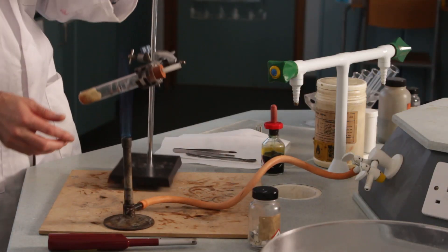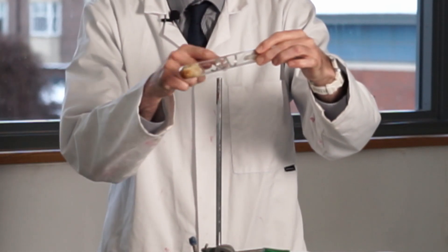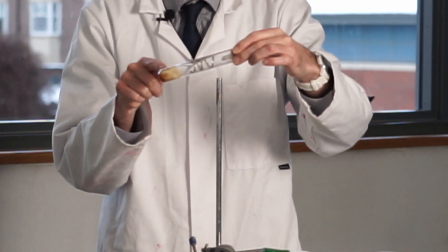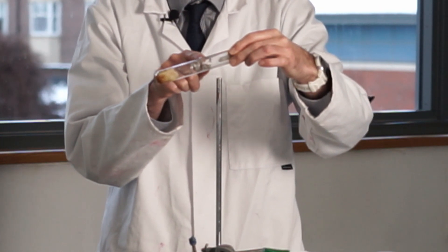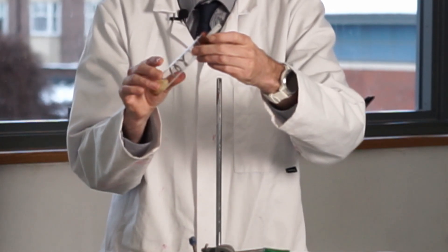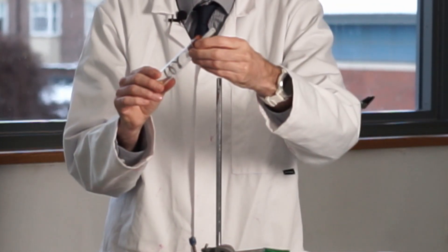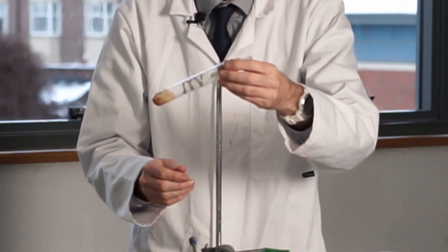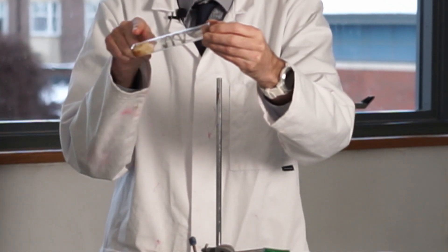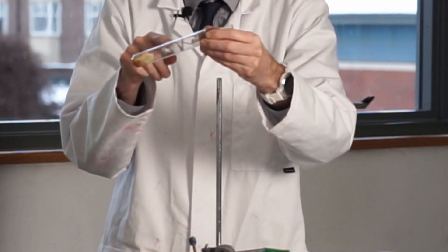This is a piece of kit where we've got a curl of magnesium sitting in a boiling tube, and down here we've got some glass wool with water in it — so the water and the magnesium are not touching. At the end of the tube there's a glass vent tube coming out. I don't want a sealed system because if I heat a sealed system, gas pressure will build up and it could explode. I'm going to heat the magnesium, get it nice and hot, then heat the water so it turns to steam — passing steam over hot magnesium.